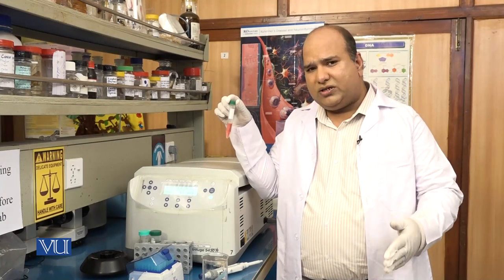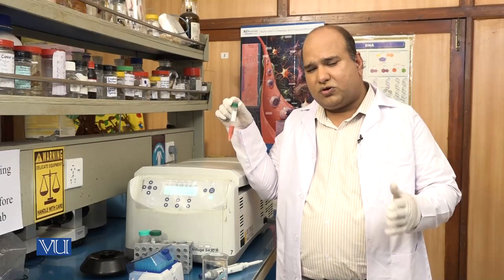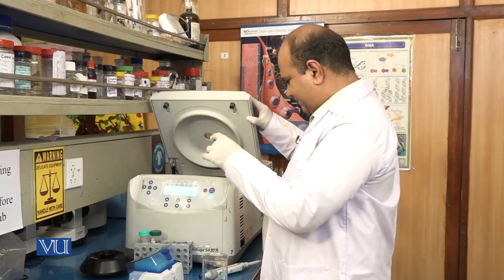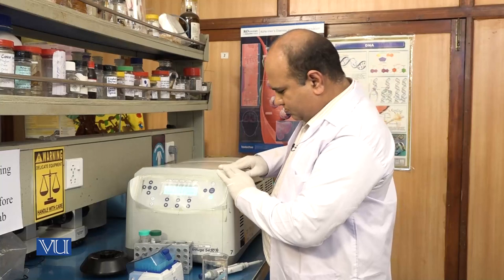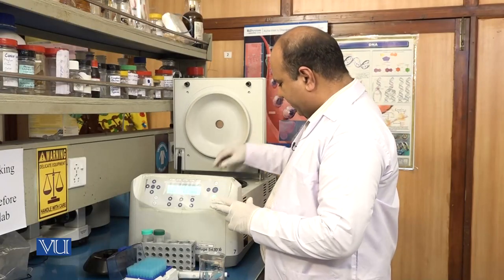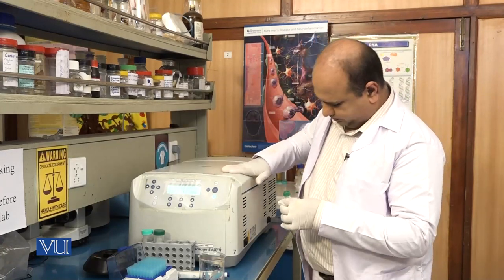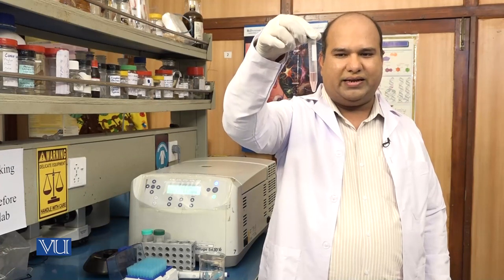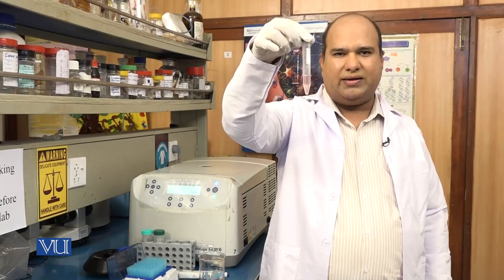These are the refrigerated fixed cells. We will now put them in the centrifugation machine again. We will centrifuge the cells not just once but 3 to 4 times so that at the end we get a very clear and transparent pellet. You can see the pellet is now in the form we require — quite transparent and clear. Let's now move towards our next phase: the preparation of slides for karyotyping.